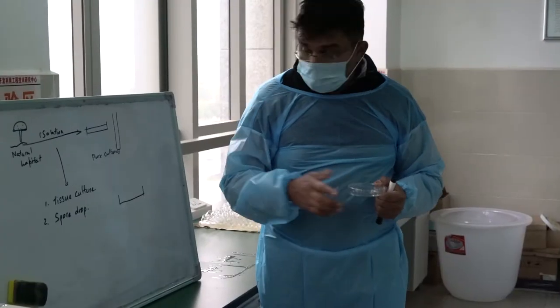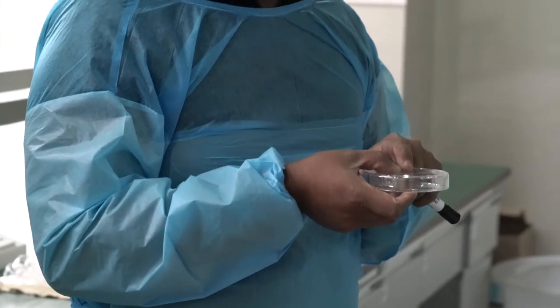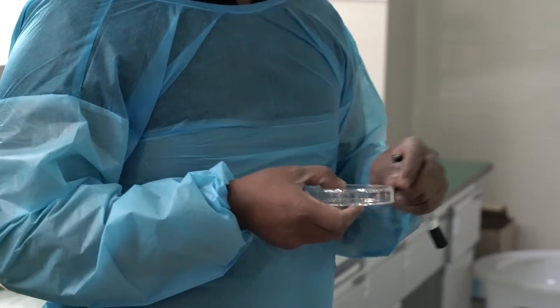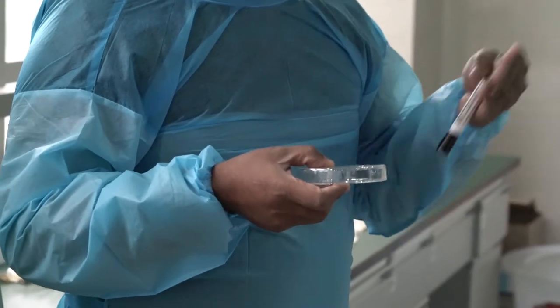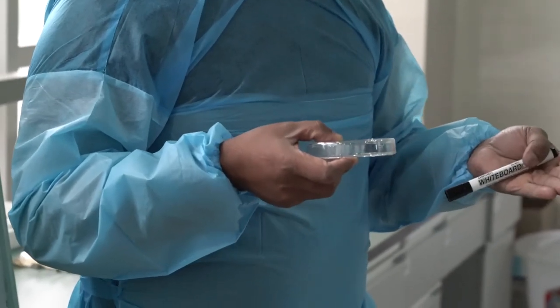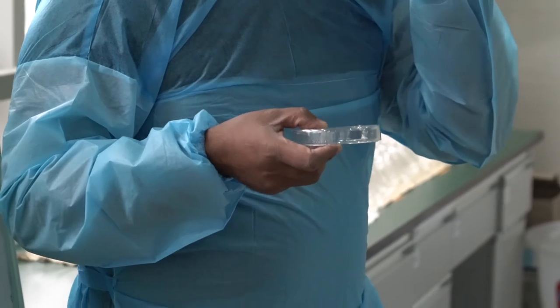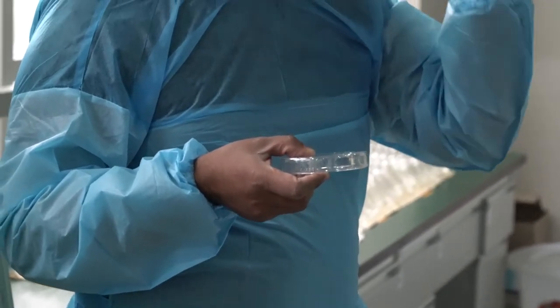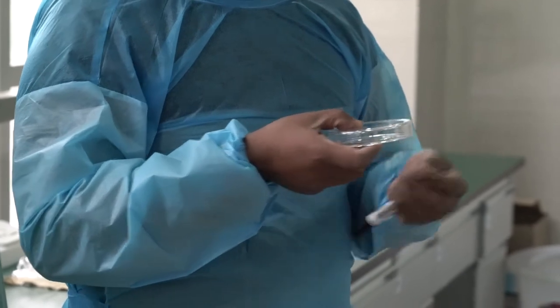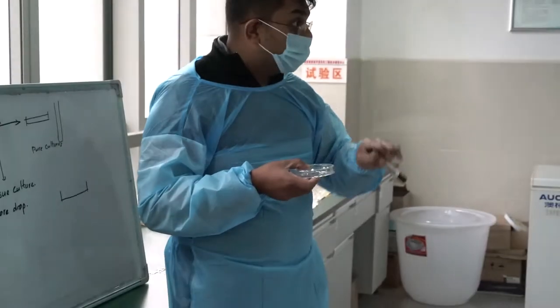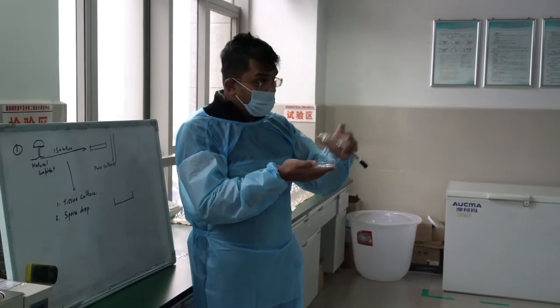But remember, don't keep it for a long time. This tissue was collected from the natural habitat and has bacteria and other fungi. If you keep it too long, those fungi will grow on the media. Therefore, don't keep it more than one or two hours, then remove the top part.